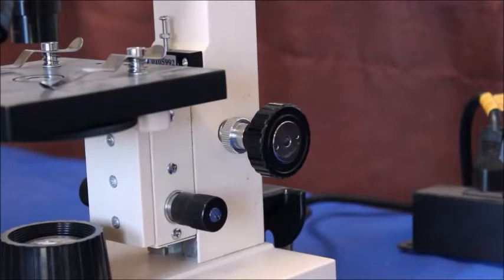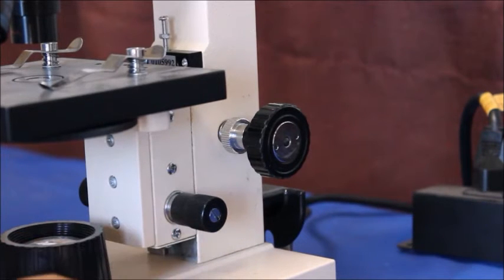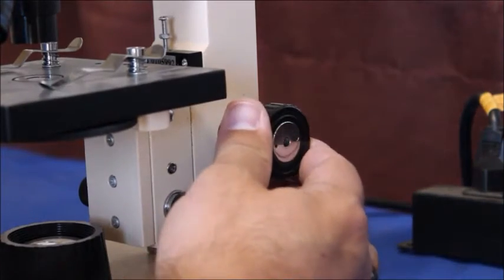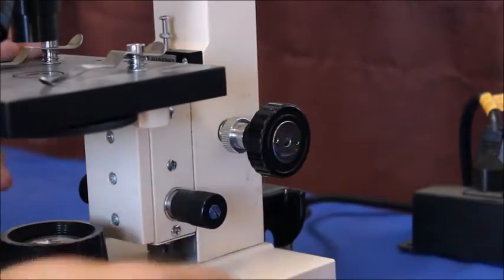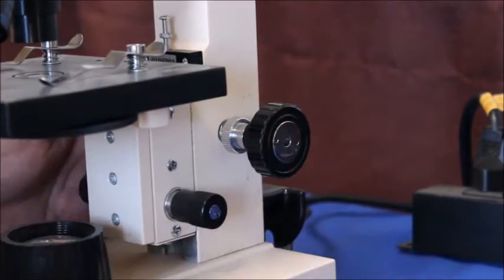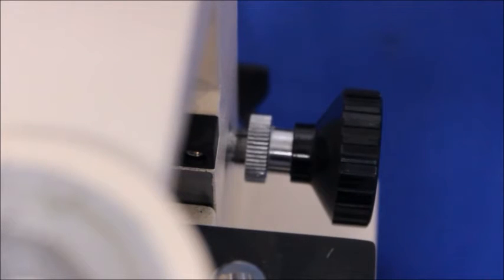This is a simple student microscope very common to most schools or hobbyists. Now this one you might notice that the focus falls down on its own or it's too loose to stay where it needs to stay.